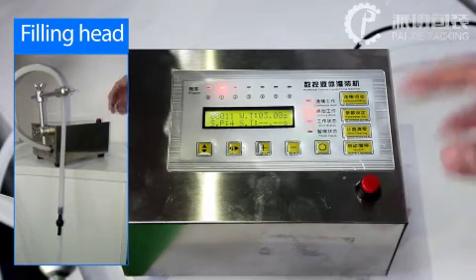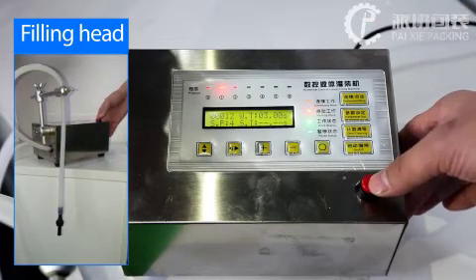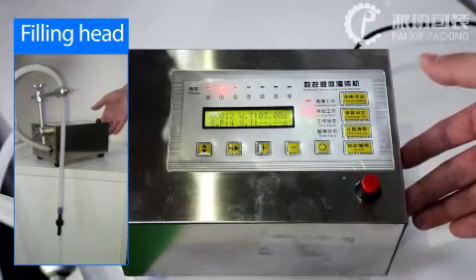The feeding speed is slowly and slower than before. Press again.